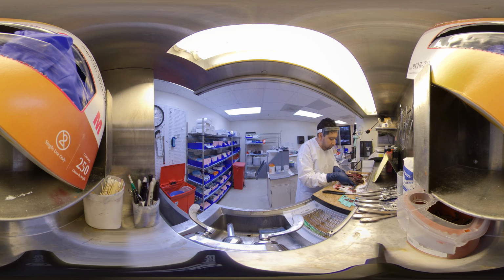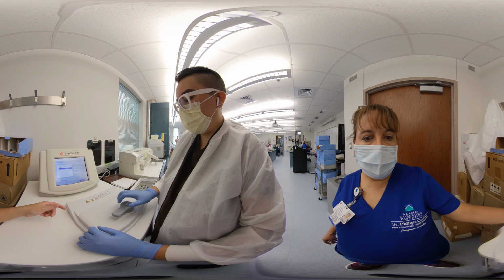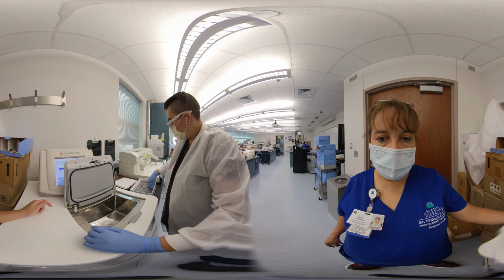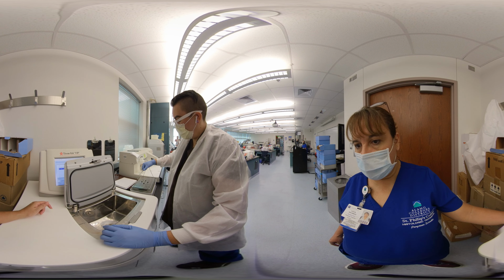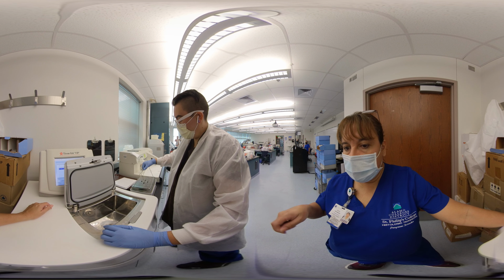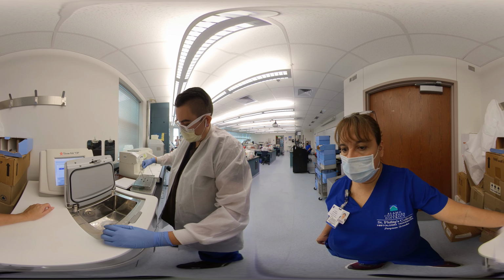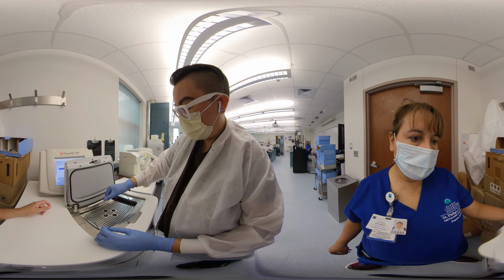The details of what occurs in the tissue processor is beyond the scope of this lesson, but it is good to know that in the tissue processor, water is removed and is replaced by hot paraffin. It is also good to know what it looks like when the tissue processor is loaded. Notice in this video a cage full of tissue cassettes are loaded into the processor.